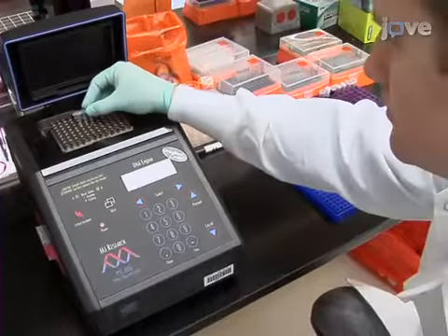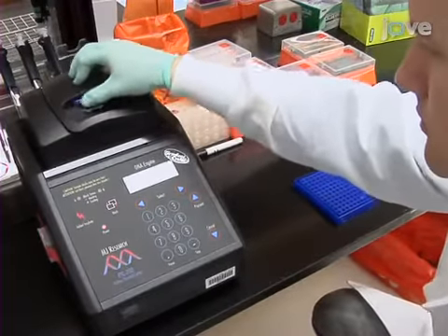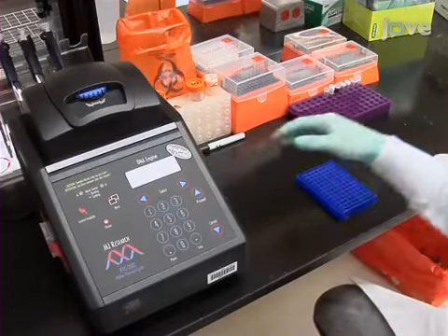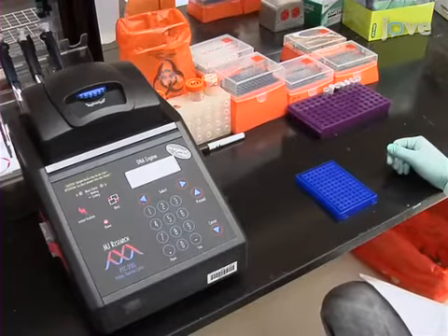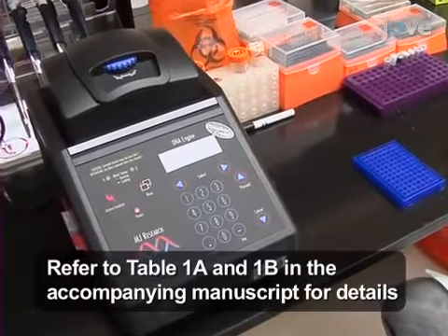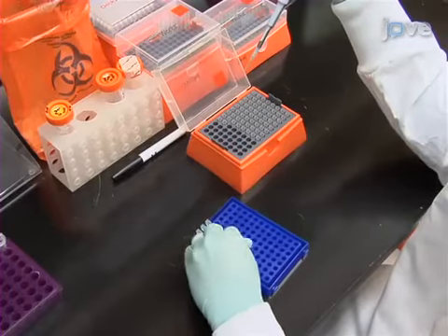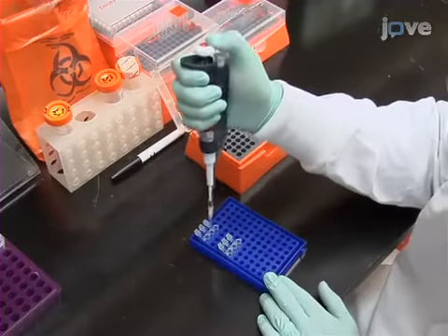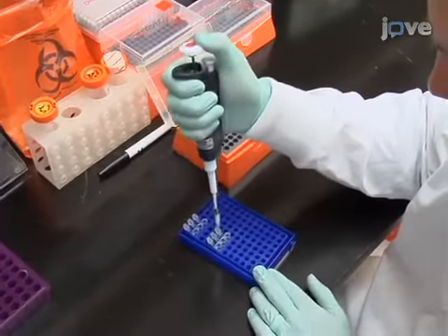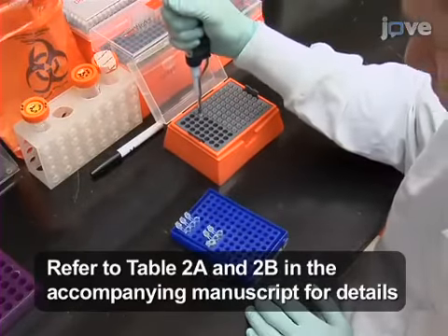To begin this procedure, reverse transcribe cDNA from RNA and amplify the first-round DNA products using reverse transcriptase and a thermostable DNA polymerase in a one-step RT-PCR. Then, using 1 microliter of the first-round PCR amplification as the DNA template, perform a nested second-round PCR amplification.